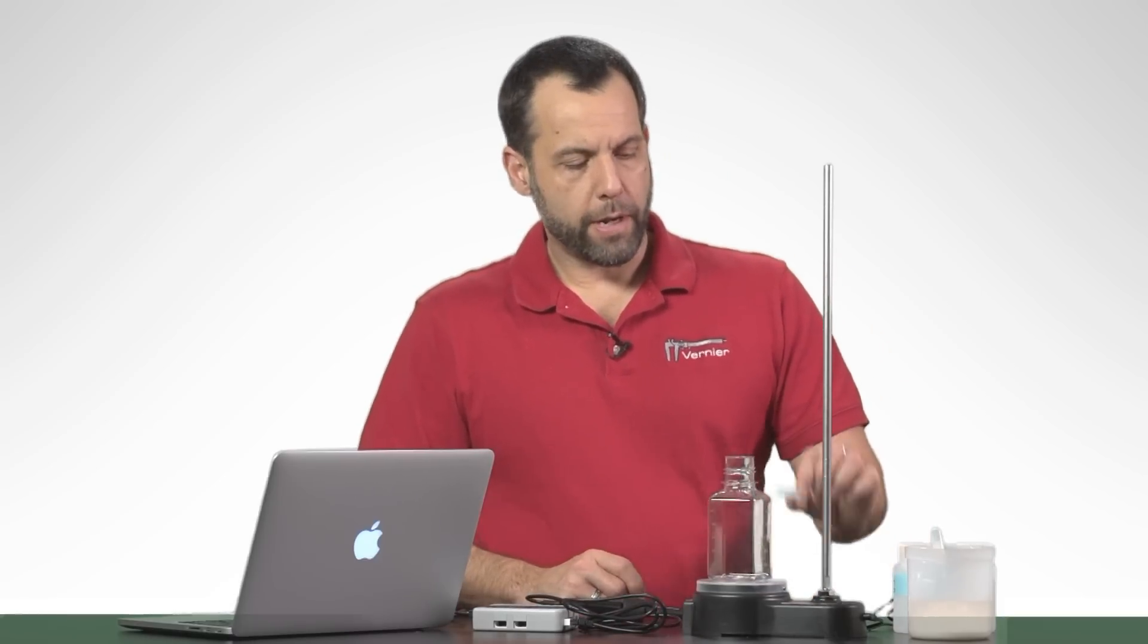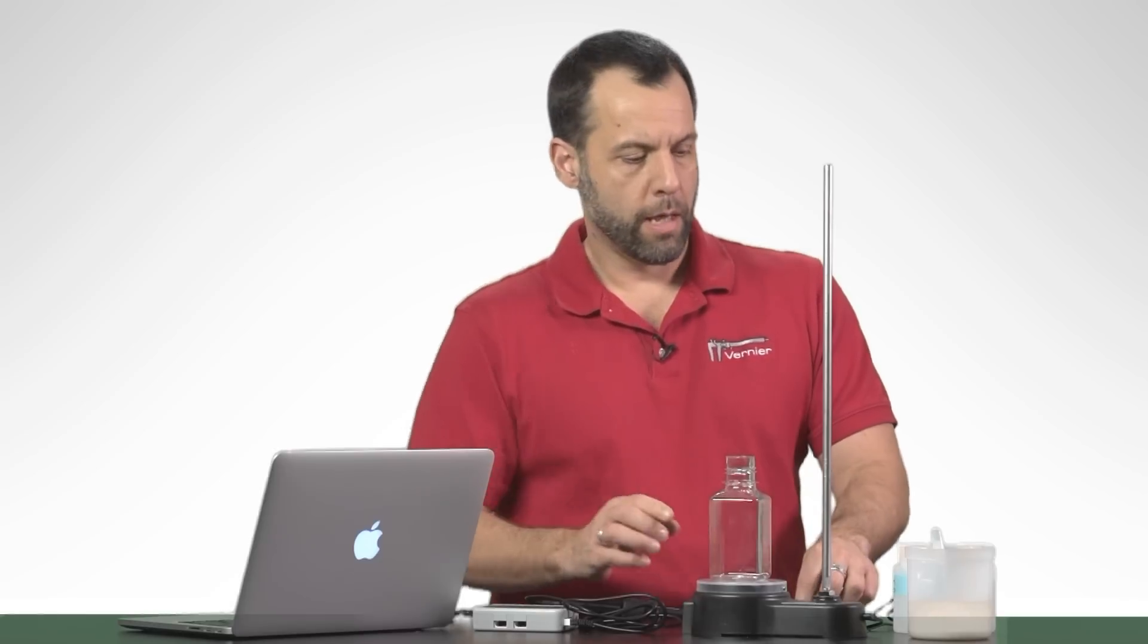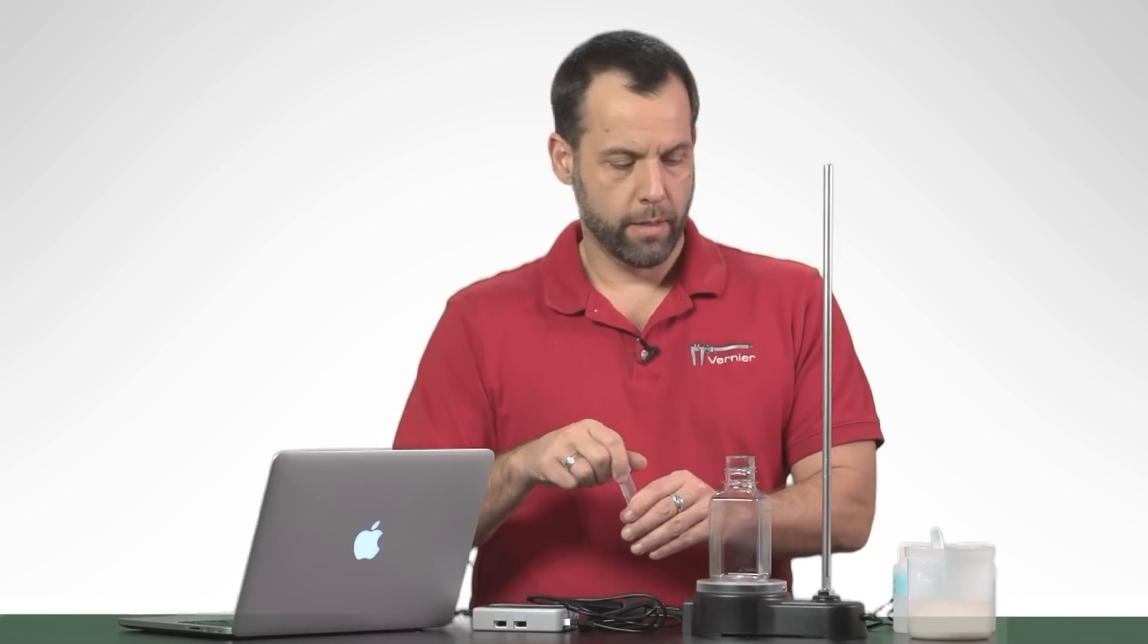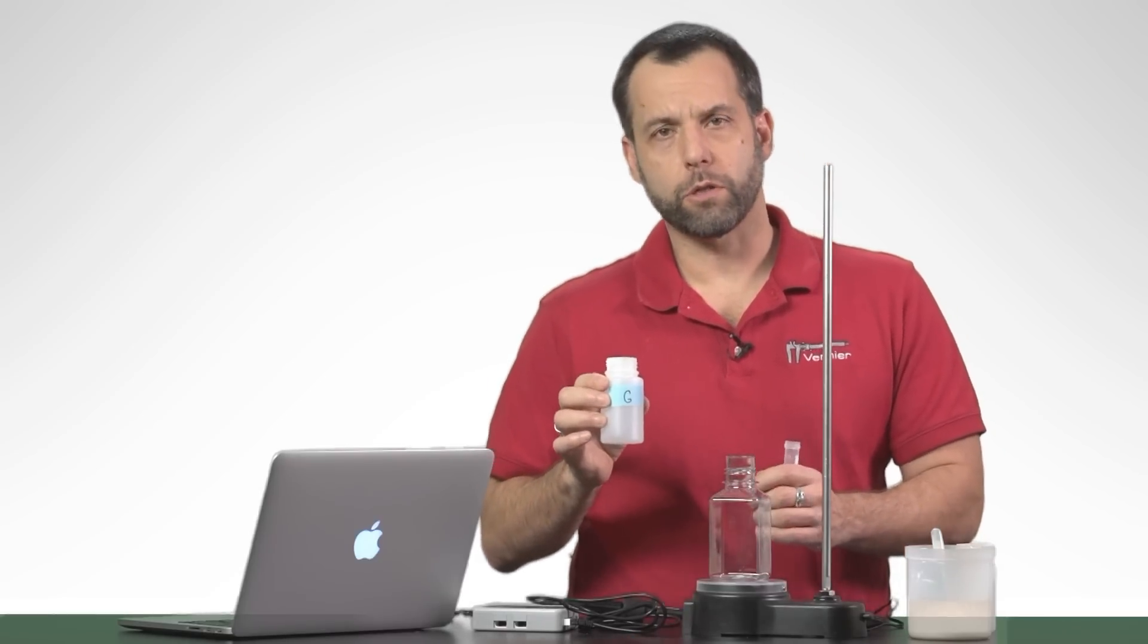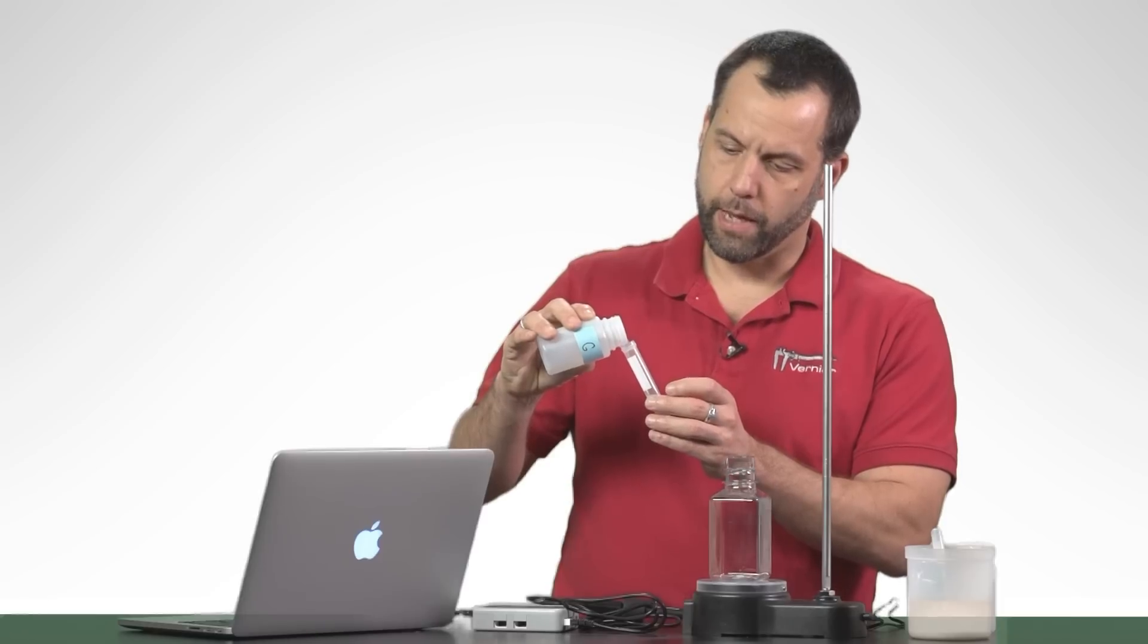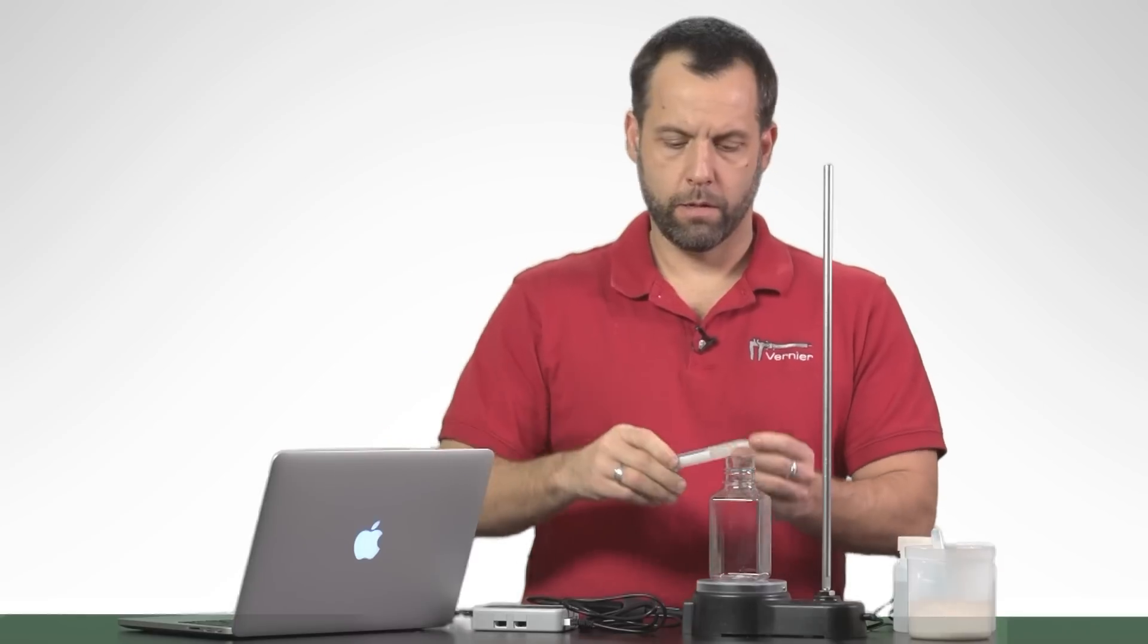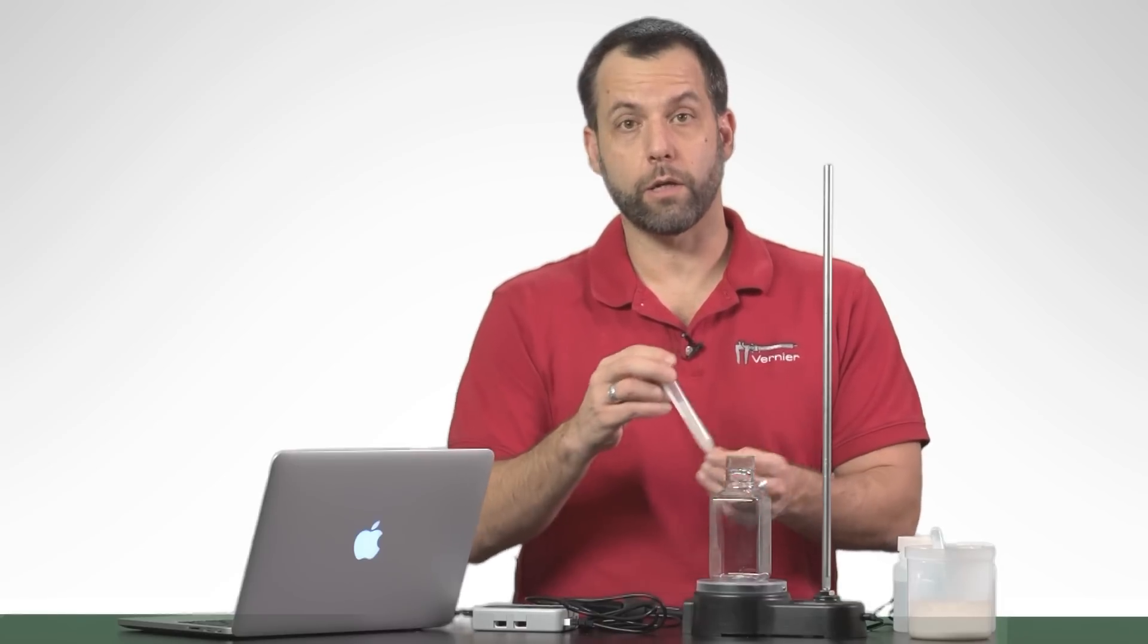Now it's going to be a little bit noisy because I'm going to actually have to use this little stir bar to move the vapor around in this bottle. But first what I'm going to do is I have a little conical tube, and in this tube I have five milliliters of yeast suspension—this is just some yeast and some water. Then I'm going to feed the yeast five milliliters of this glucose solution. Actually, I'm just going to pour another five milliliters into here so that it reads ten milliliters. Then I'm going to cap it and invert it just three times. I like to invert it three times just so that I mix the yeast really well with the glucose solution.